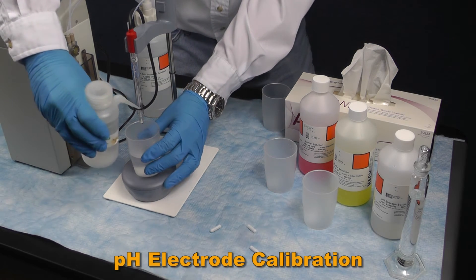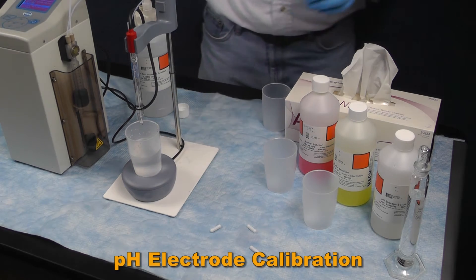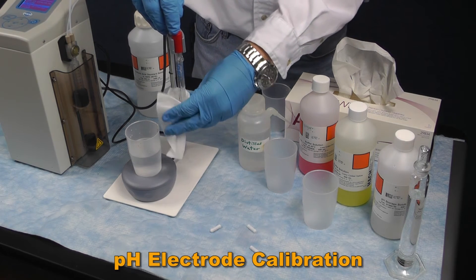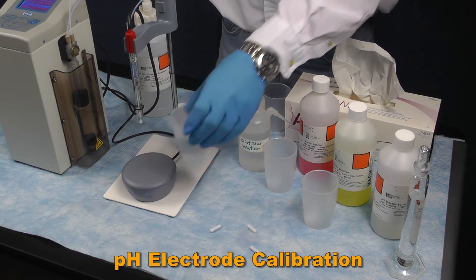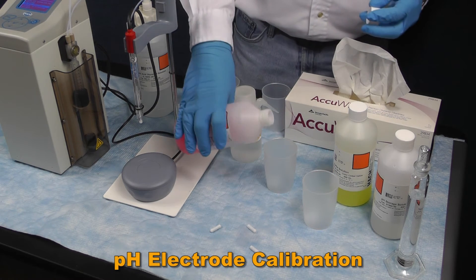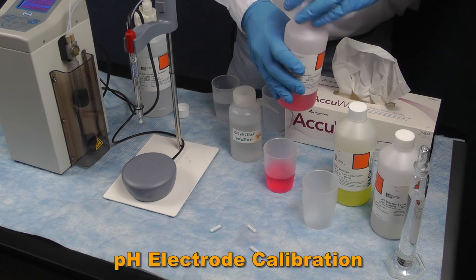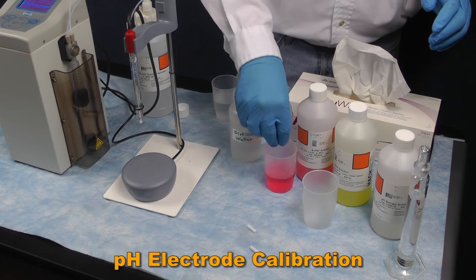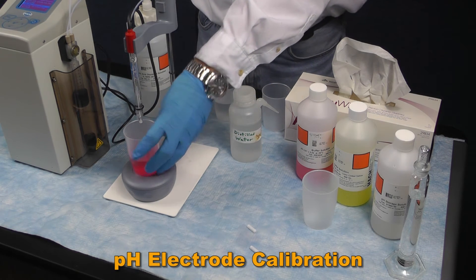Next, you can calibrate your pH electrode. Place a waste beaker under the probe on the stand and rinse the probe with some DI water. Blot the probe dry using a chem wipe or AccuWipe. Pour out about 50 mL of a pH 4 buffer into a clean sample cell. Place a stir bar into the buffer and place it onto the stand. Lower the probe into the buffer.